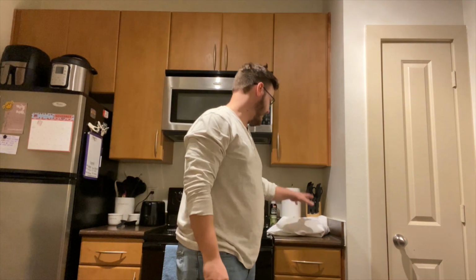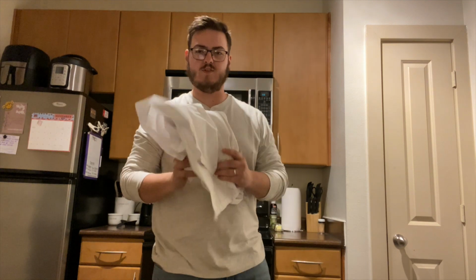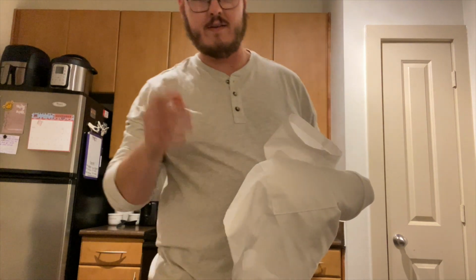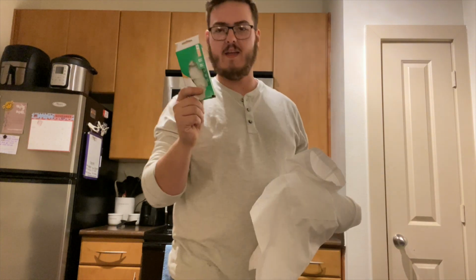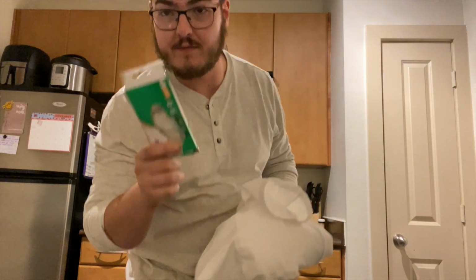All right, so before you get started with any of your lab procedures, first thing you're going to need is your lab coat. You're going to need proper safety glasses, closed-toe shoes, and of course your gloves for handling materials. So you've got your proper lab attire on. We'll go through some of the materials you'll need for this kind of project.